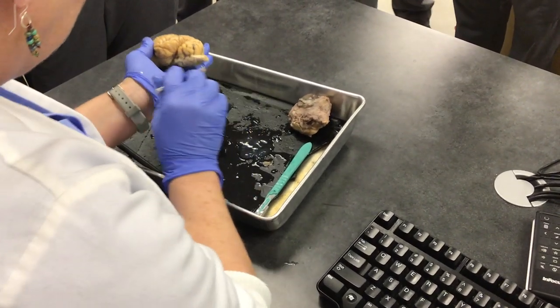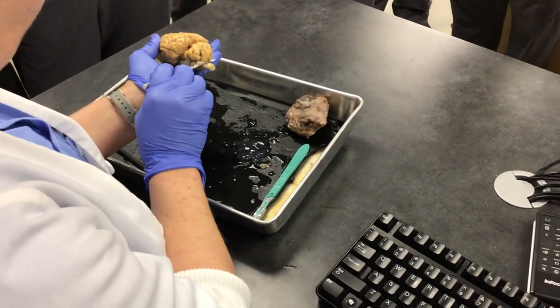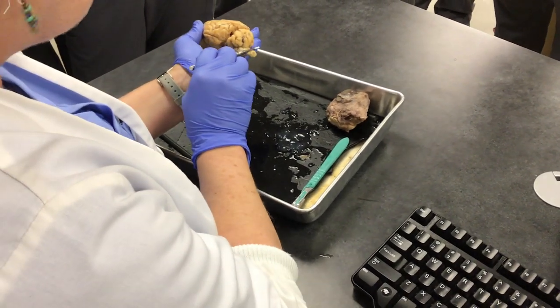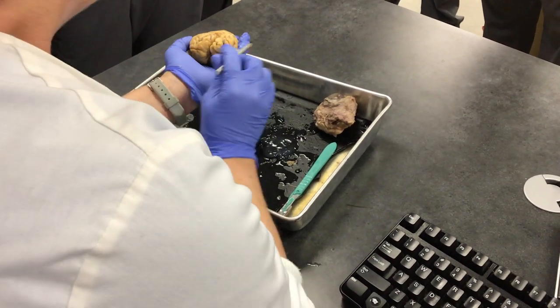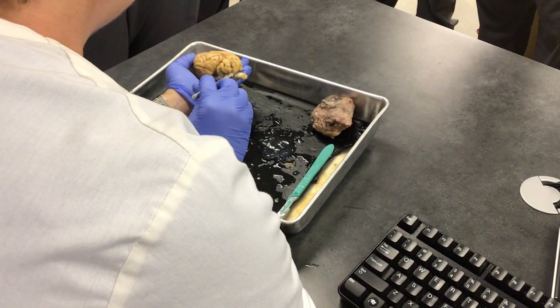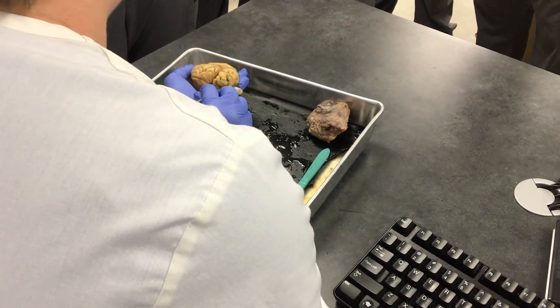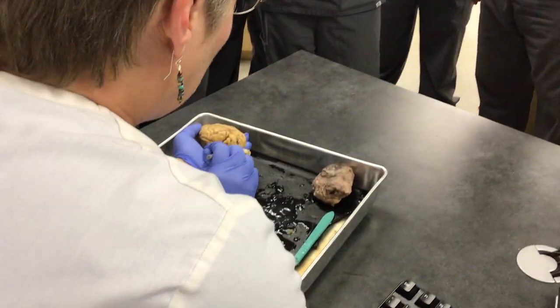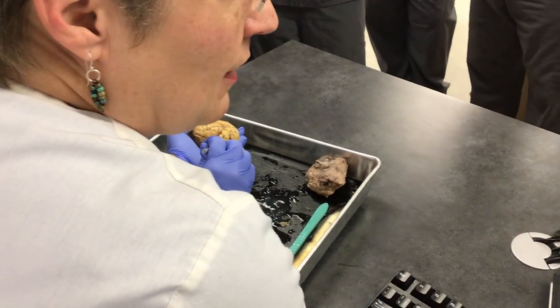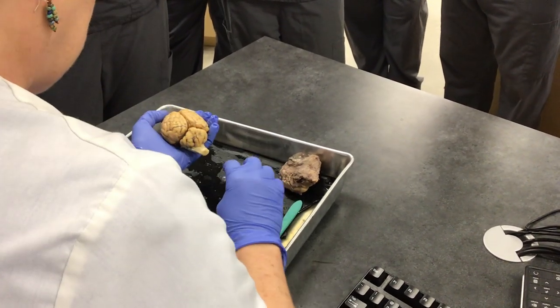What about this little guy? This is referred to as the little brain — the cerebellum. And what is this? The spinal cord — it would be the brain stem. So when we have an injury here, what does that mean? Paralysis, or death, because this is where all of our breathing and function is controlled.